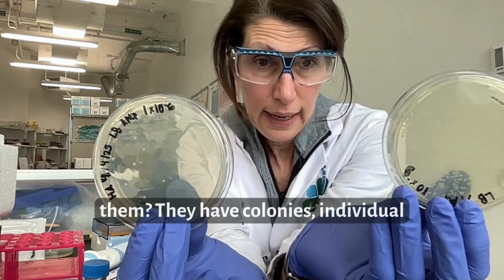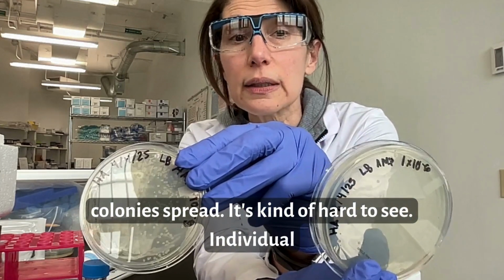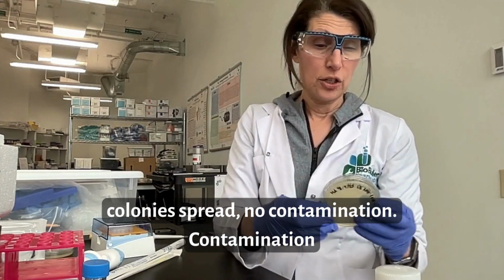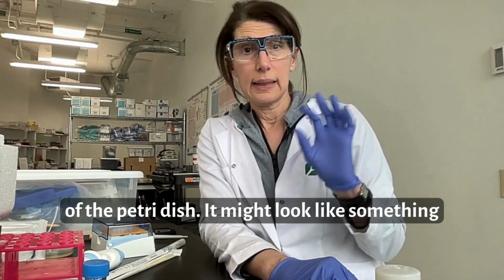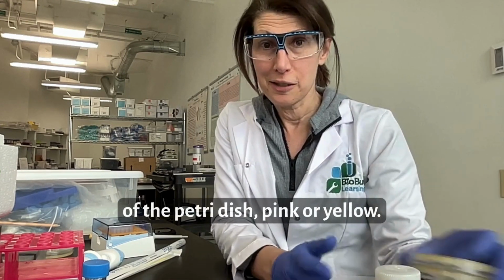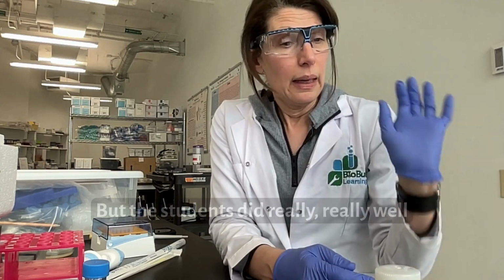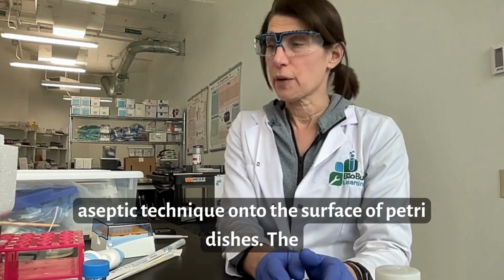Can you see them? They have colonies, individual colonies spread. It's kind of hard to see. Individual colonies spread, no contamination. Contamination might look like something fuzzy growing on the surface of the Petri dish. It might look like something not cream colored growing on the surface of the Petri dish, pink or yellow. But the students did really, really well spreading their cells with aseptic technique onto the surface of our Petri dishes.